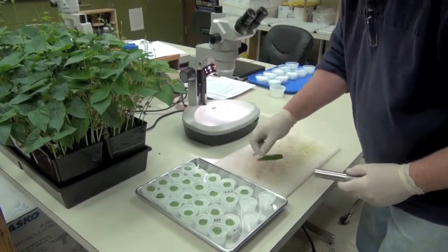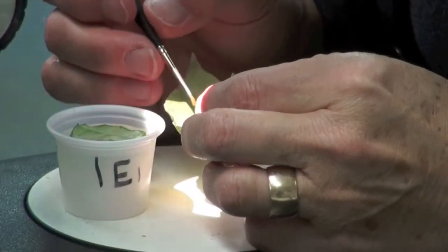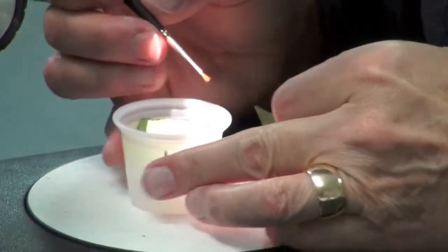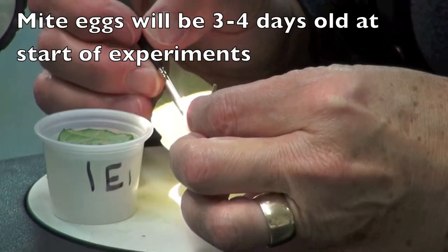Towards the end of the second week, smaller leaf discs are cut from bean leaves. We will again transfer adult female mites onto the smaller leaf discs and allow them to lay eggs for 24 hours. These will be the group of mite eggs used in our experiments.